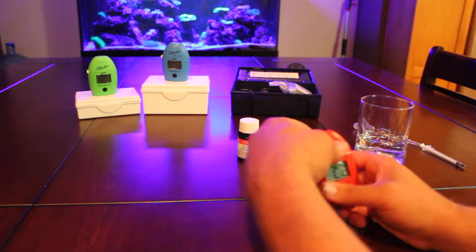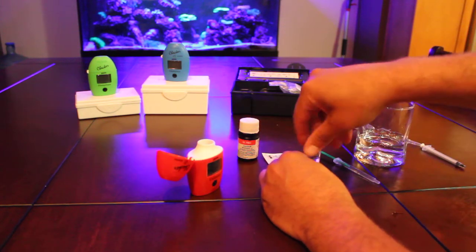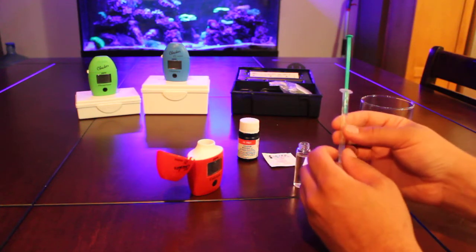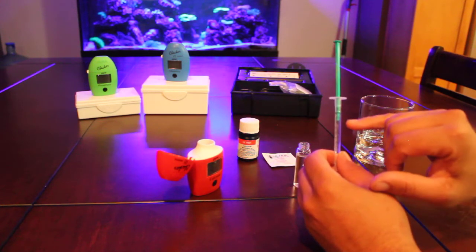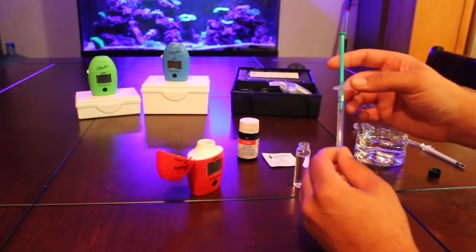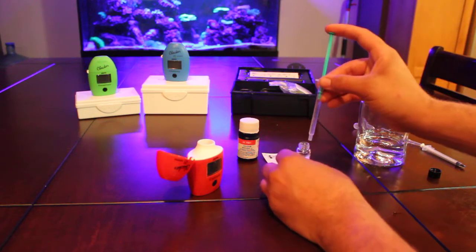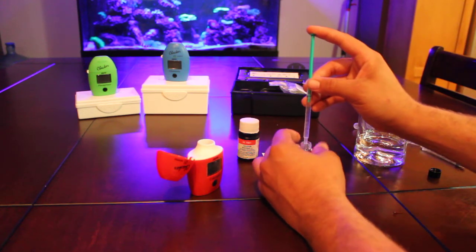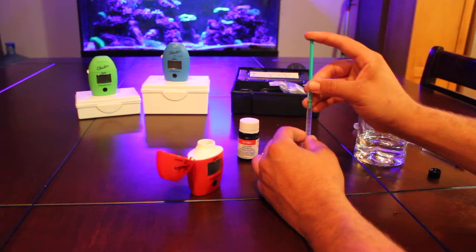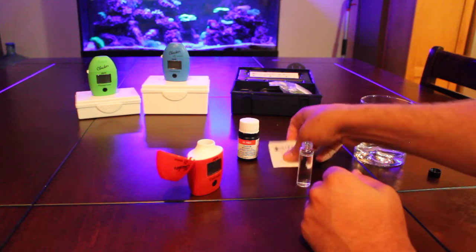Okay, add number two. And all part two is, is 0.1 milliliter. So this is one milliliter, sorry, one milliliter tube. So you fill it all the way to one milliliter and just push down to 0.9. And that's just regular tank water.